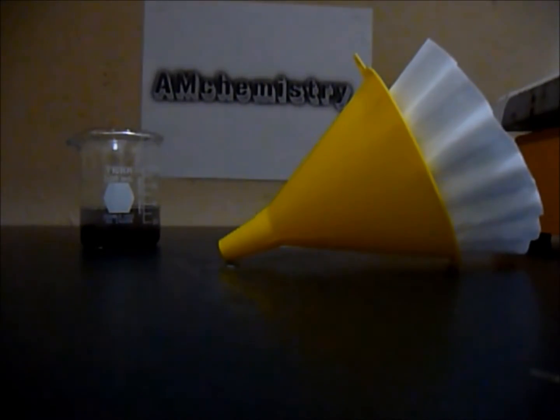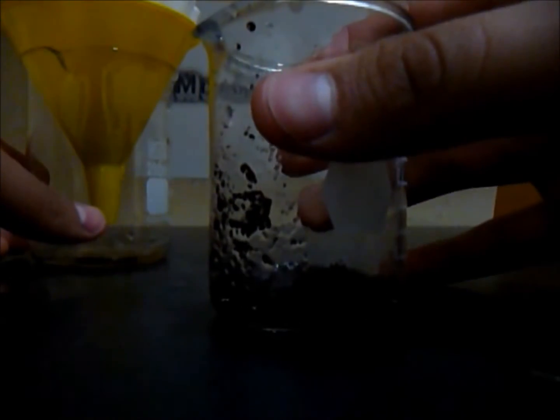I'm using this, and a good idea is to put water. Let me get my water. Distilled water is the best. Just give it a wet with the distilled water. So the next step is pour all of the zinc sulfate right here, and all of the leftover right here is pure copper metal in powder form.